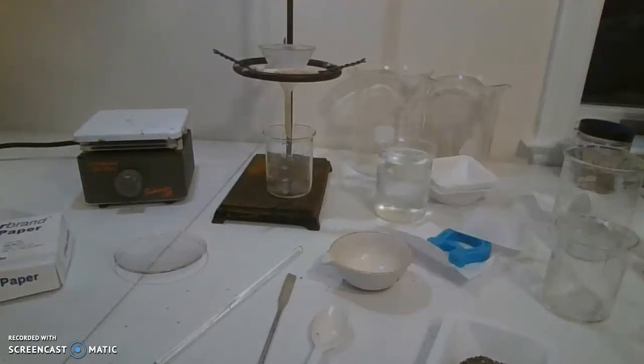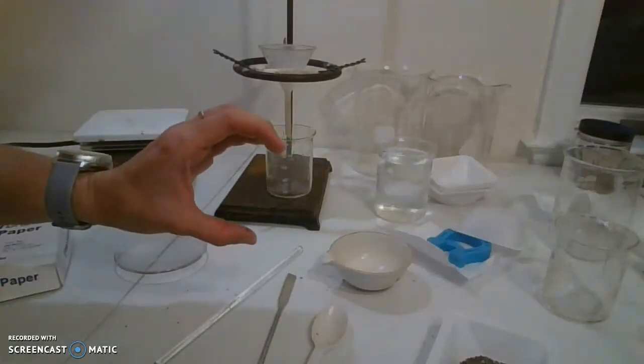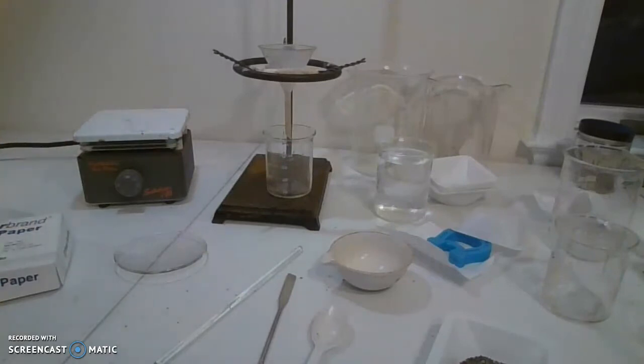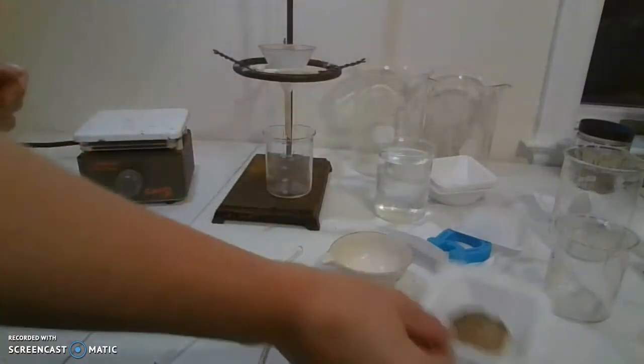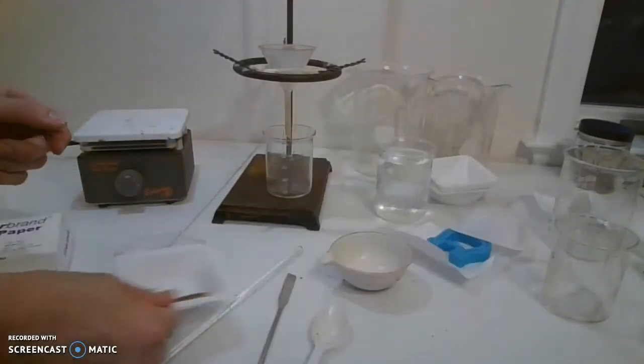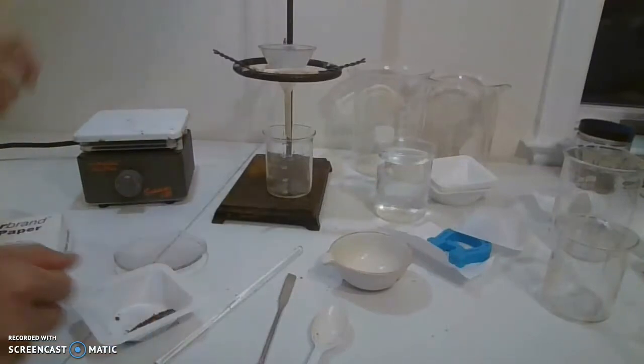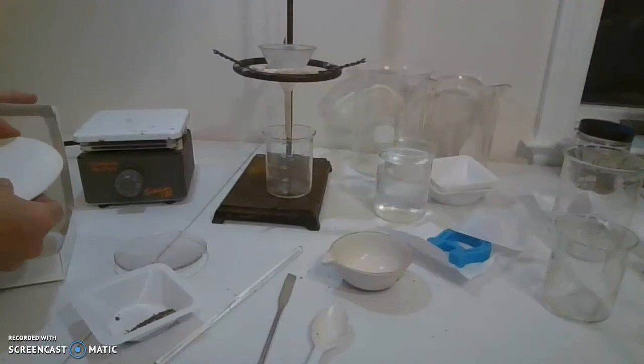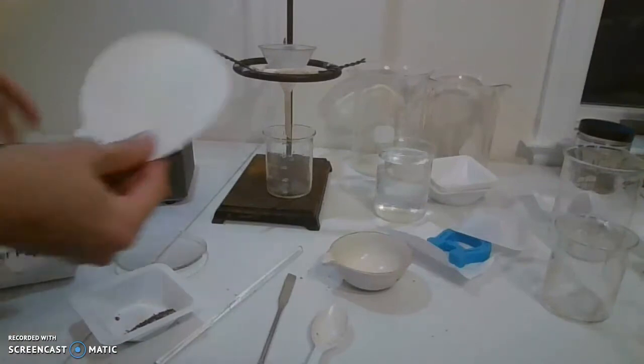If you're watching this video, you chose option C, which is to take this whole mixture and put it into the funnel right away. So we're going to take a piece of filter paper out.